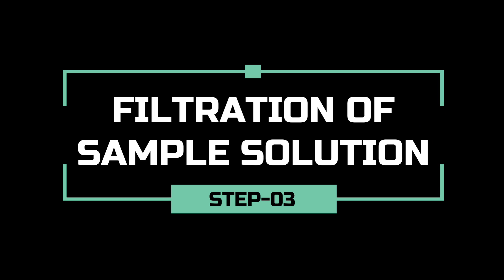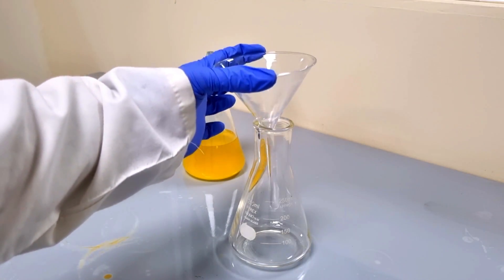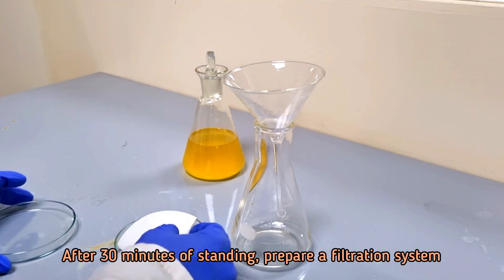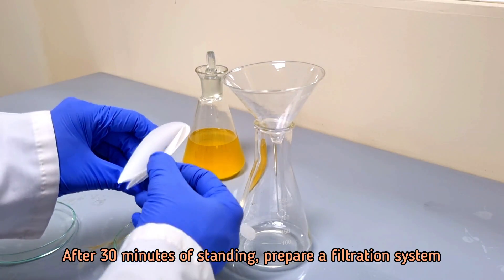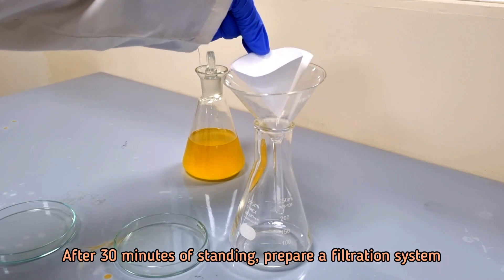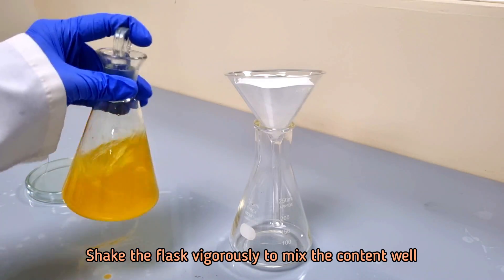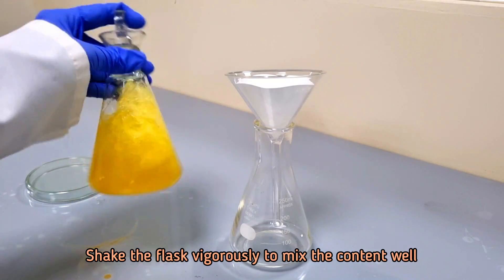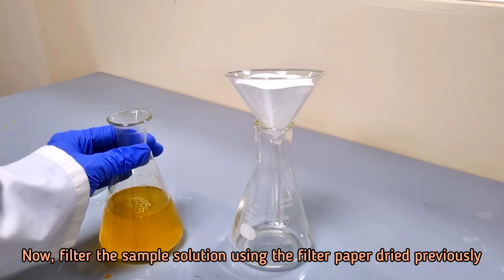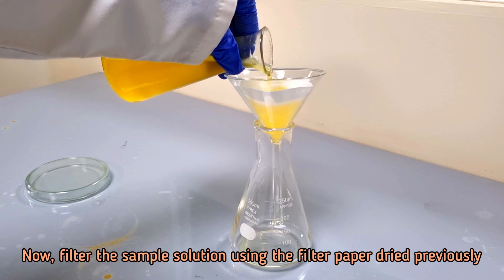Allow the flask to stand for 30 minutes. Now we have to filter the sample solution. Prepare a filtration system. Filter the sample solution using the filter paper dried previously.